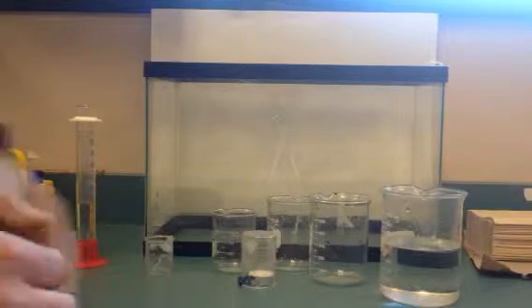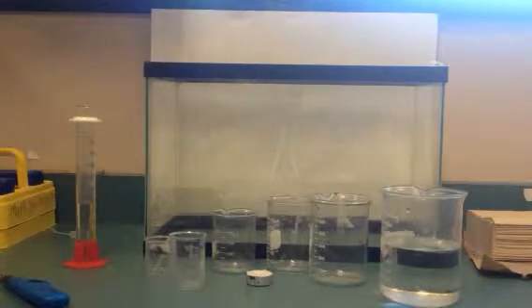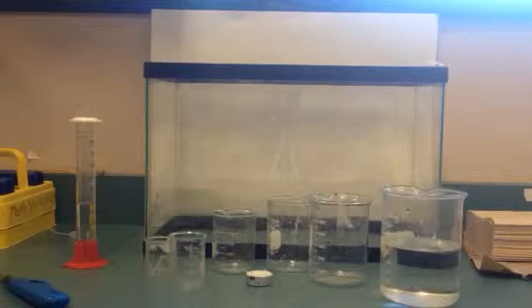Okay? And we tried to do between 2 and 4 trials for this lab. And again, rather than actually me trying to give you data on here, you can download a makeup data table on the website to help you make that data up. Okay? So that's the first part of the lab.